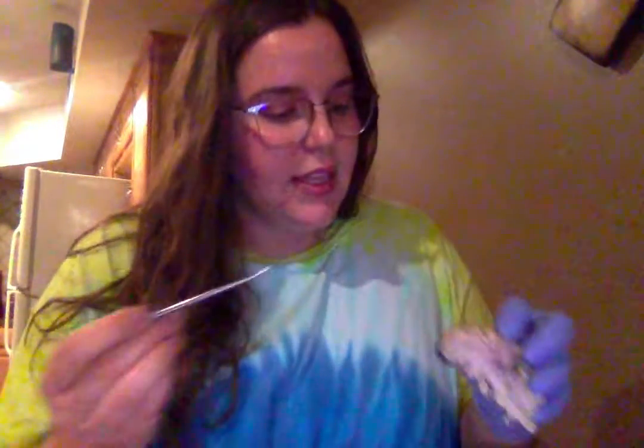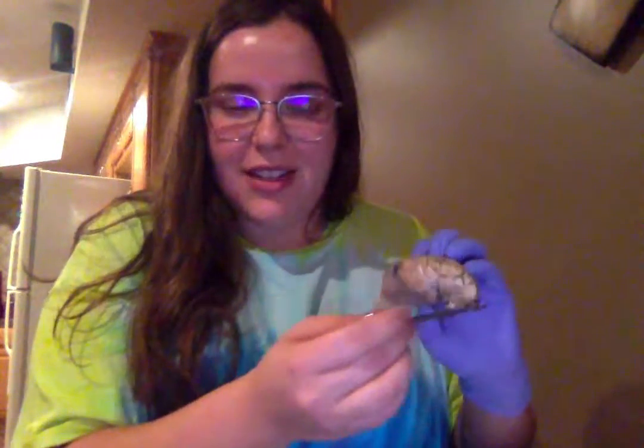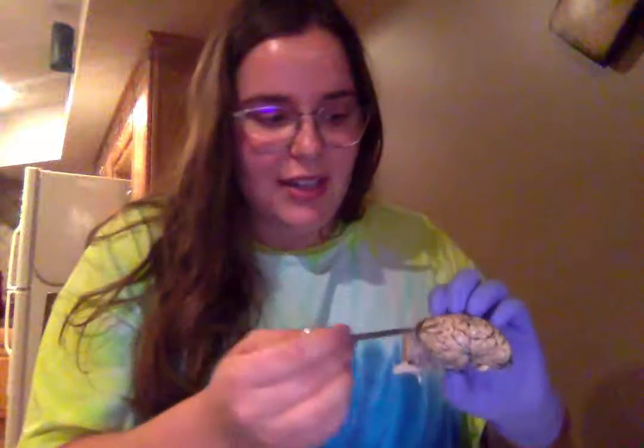And then next is the cerebral cortex. There isn't one place where the cerebral cortex is necessarily present, but it's all around the brain. It's not a specific part in the brain.